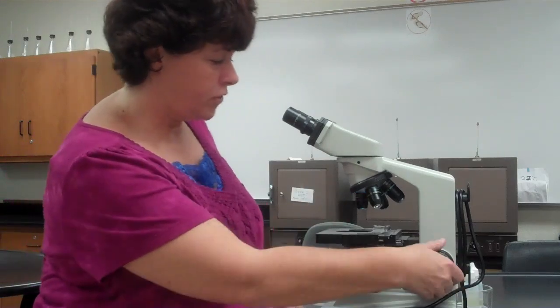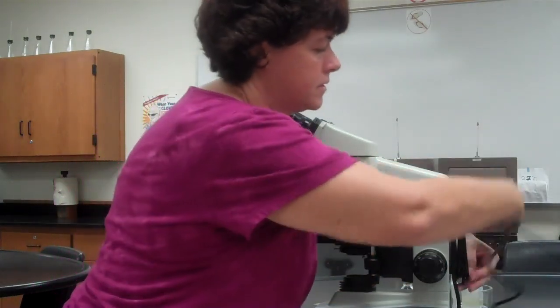So now I'm going to take it, always turn it to where the lowest power is facing down. You're going to turn off your microscope, lower the stage completely. You're going to center the little arm, and you're done. So now you unplug it, wrap the cord around the back. Probably don't need to do for you. You're going to put the cover on it.